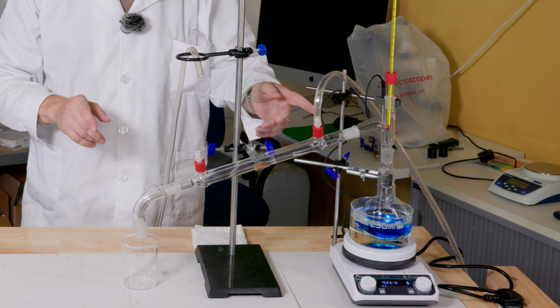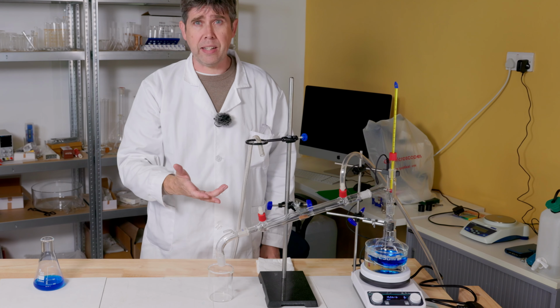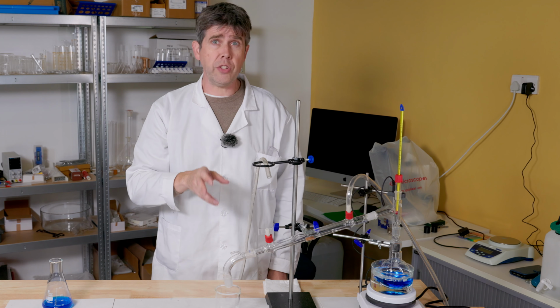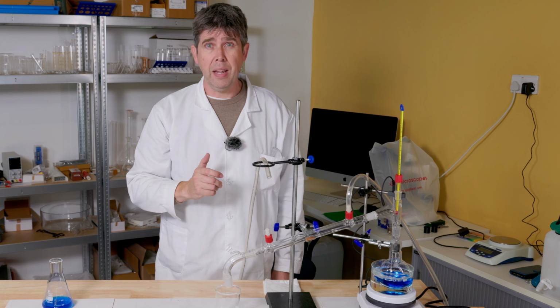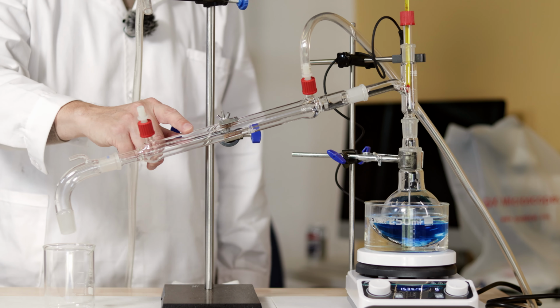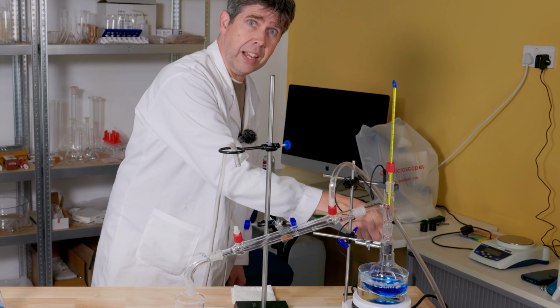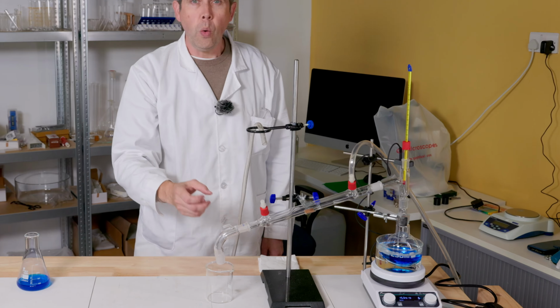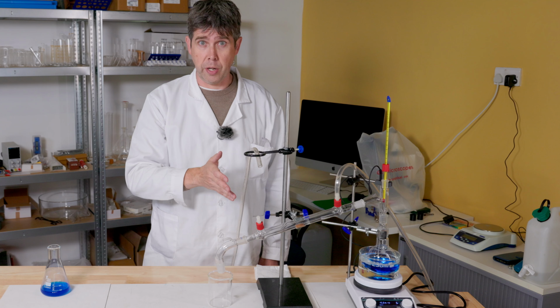The key piece of equipment here is this, a Liebig condenser, and although it looks complex, it has a very simple job. It is designed to rapidly cool a hot gas and cause the particles to condense back into the liquid state. It is really just two glass tubes, one inside the other. The inner tube carries the hot gases from this vessel here, all the way through and down to this collection point here, while the space between the two tubes is filled with cold water.